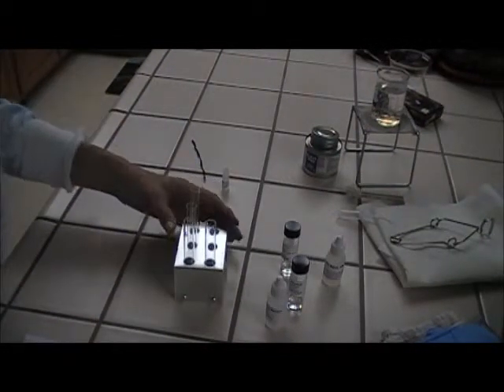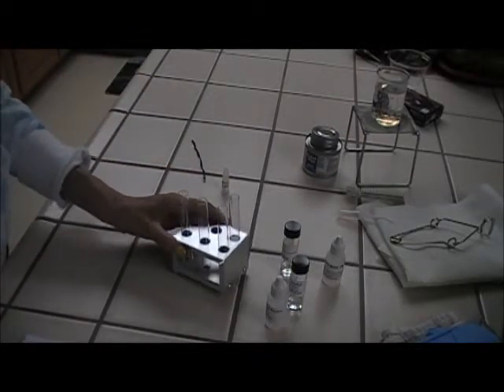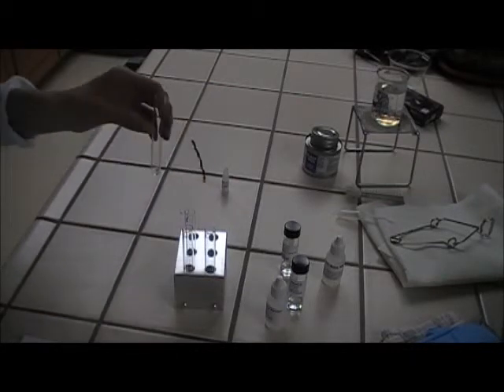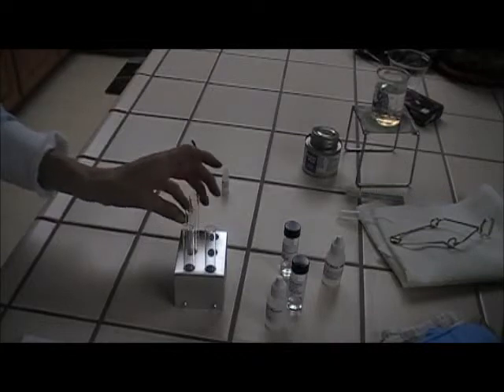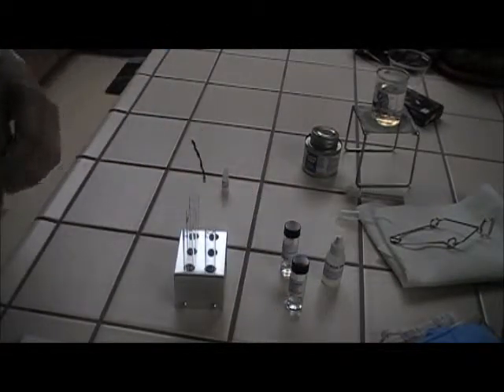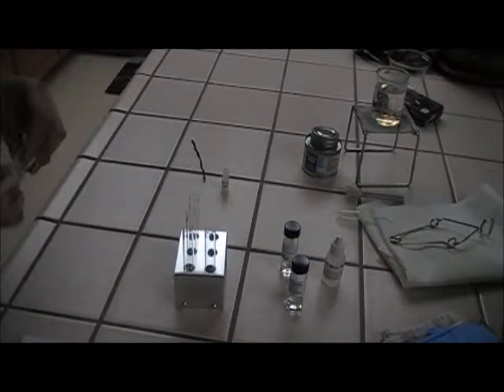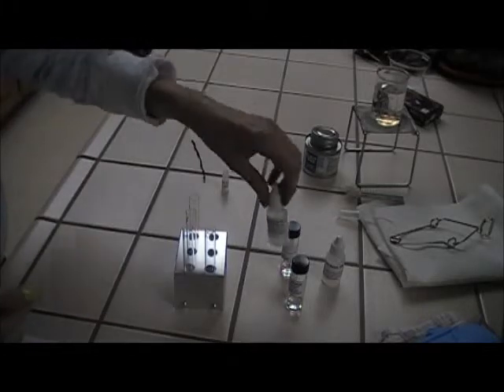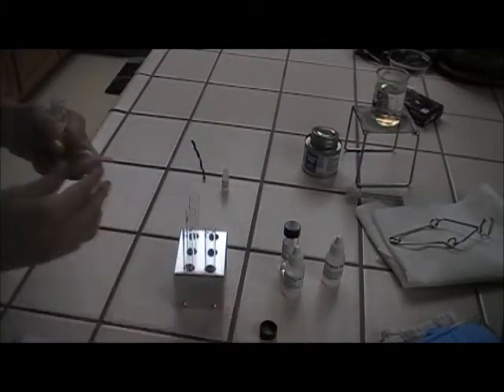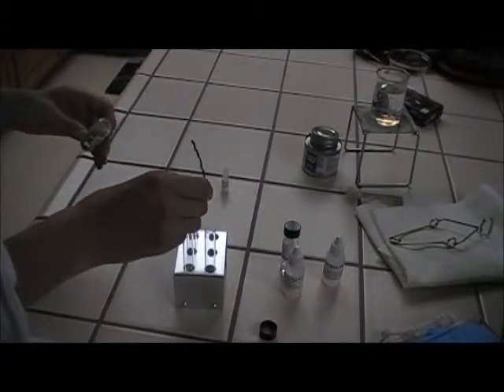Okay, so in test tubes you can see 4, 5, 6, and 7. In 4, 5, and 6, I placed 4 drops of butyric acid into each. In test tube 4, I should be placing 5 drops of methanol, but because I do not have the methanol, I can't do that part of the experiment. So I will continue with the ethanol and place 5 drops of the ethanol into test tube 5, and 5 drops of the alcohol into test tube 6.